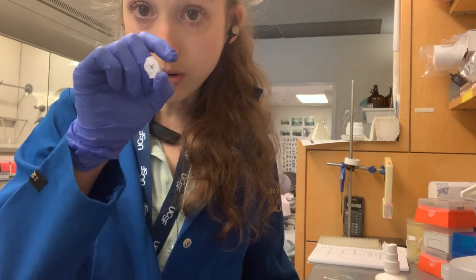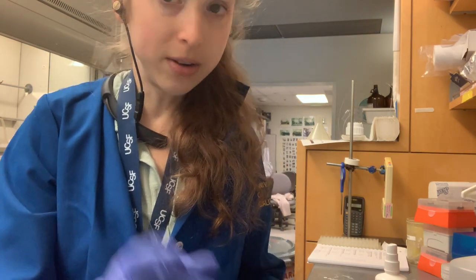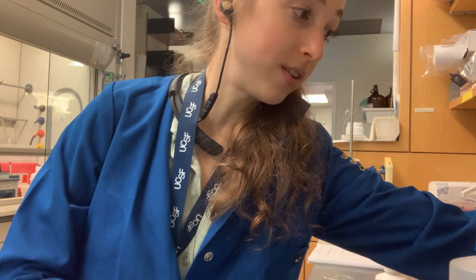What about Eppendorf tubes — these little tiny tubes? Now you have to write even tinier. It's really great if you have a fine point Sharpie or a lab version of it.